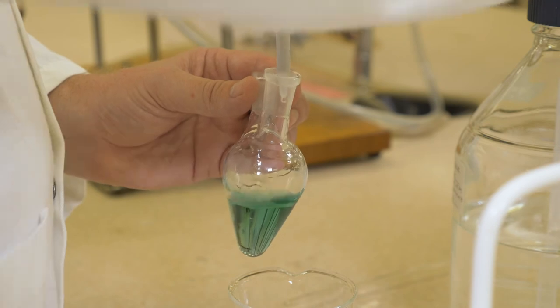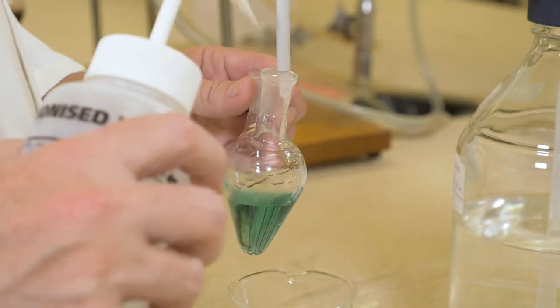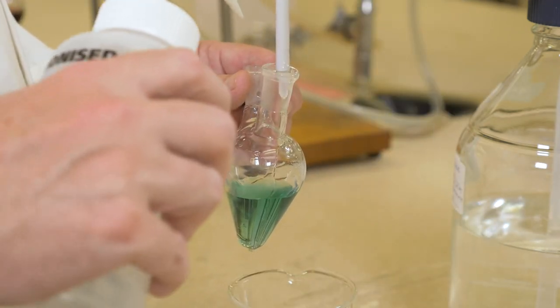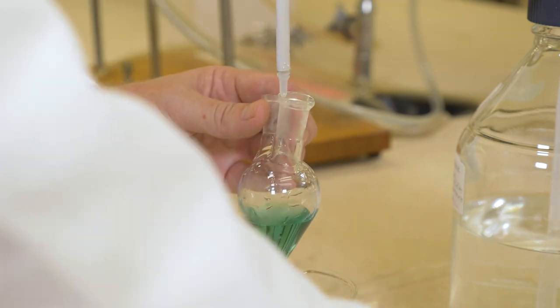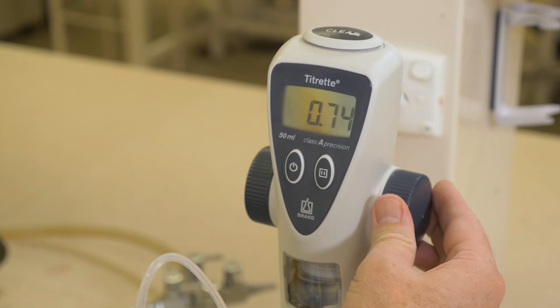When the endpoint has been reached, rinse a small amount of water through the bubbler to ensure no unreacted solution is trapped within it. Note the volume of sodium hydroxide required.